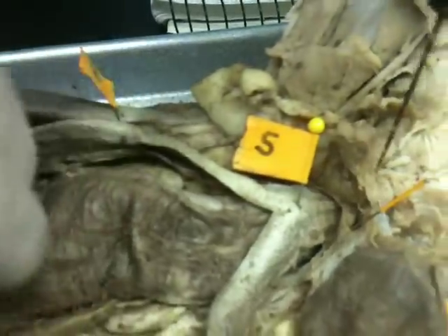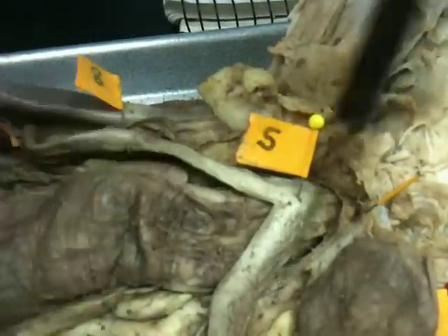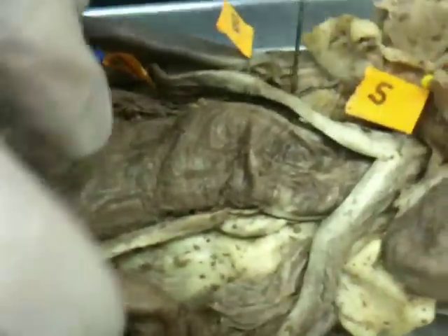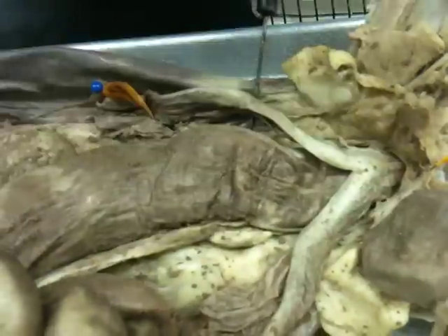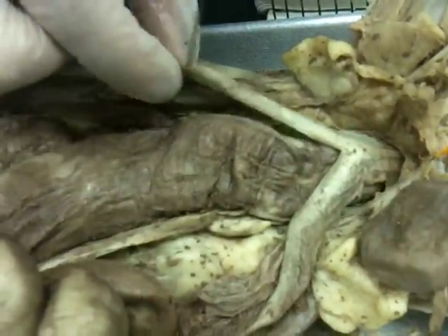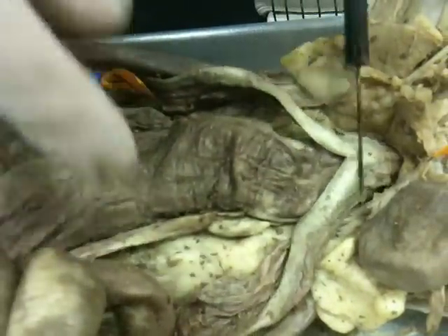Whenever the uterus splits here, you can see it goes on both sides. These are known as the uterine horns — this is a uterine horn on this side, and this is a uterine horn on the other side.